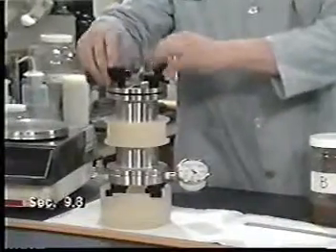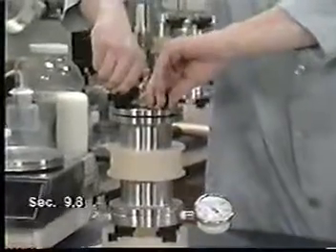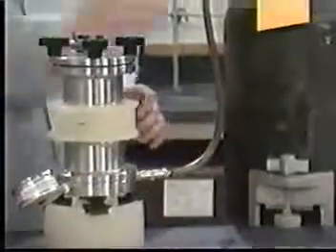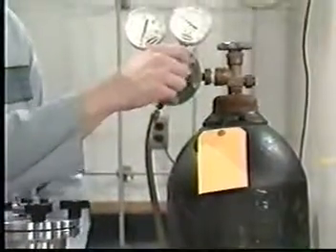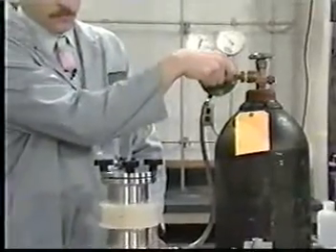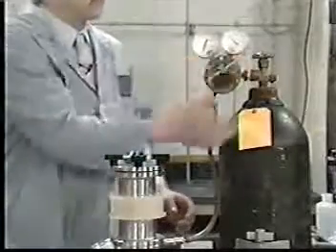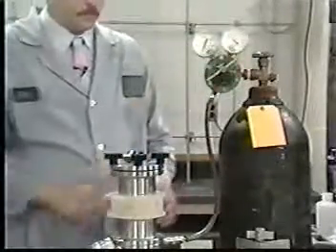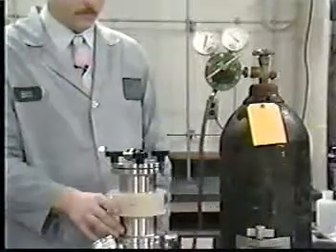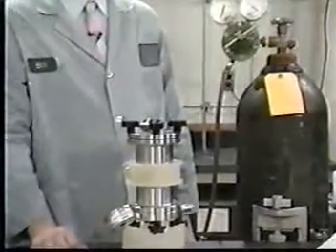If more than 1% of the sample weight has adhered to the transfer container, measure and subtract it from the sample weight used. Attach a gas line to the gas inlet-outlet valve on the bottom flange. With the liquid valve open, begin to apply 1 to 10 psi, or more if necessary, forcing all headspace out of the ZHE into a hood. At the first appearance of liquid, close the valve and discontinue pressure. If more liquid will be expressed, allow the sample to warm to room temperature.